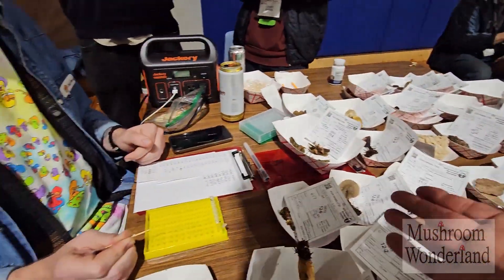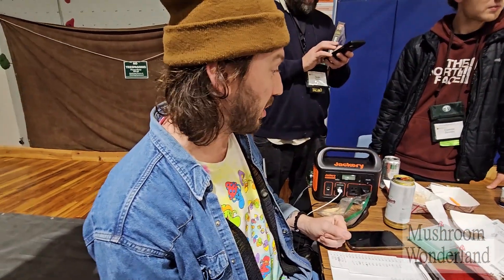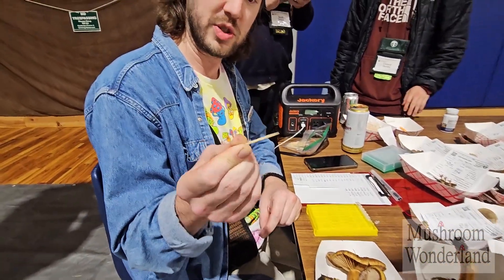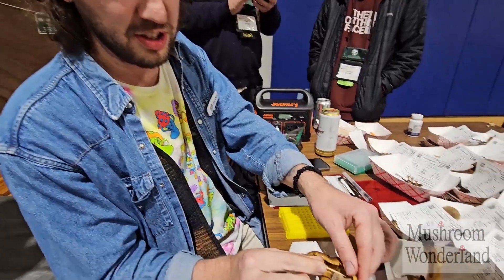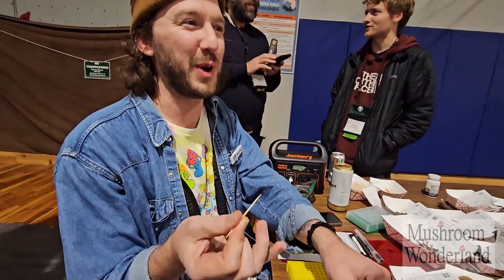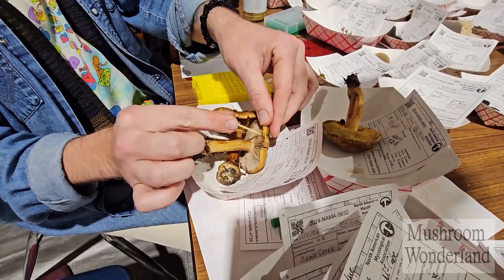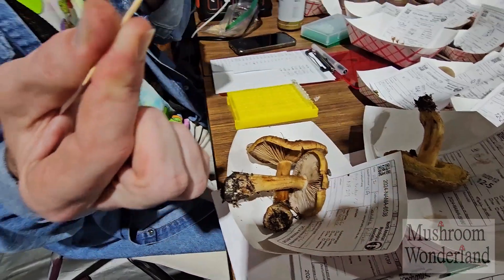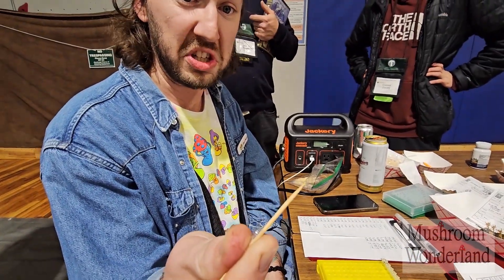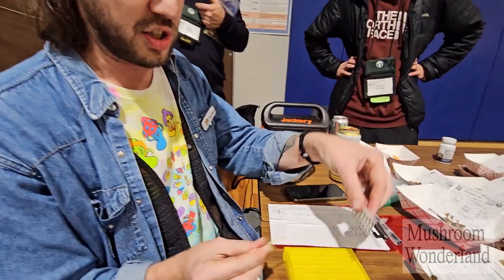With all these different mushrooms, this is the first step in the barcoding process: sampling. Since they're using wet tissue, the method involves swiping with individually wrapped toothpicks — sterile, at least for other fungi. The primers used would eliminate plants, insect tissue, or anything like that. They're rubbing through the gills until they get just the tiniest amount of tissue.